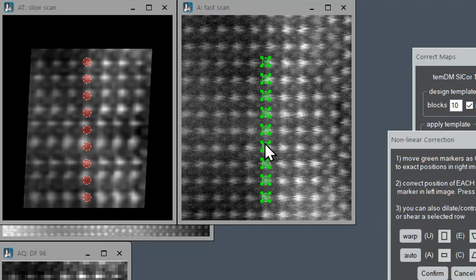Okay, I think we positioned that more or less correctly. And now let's look at the red markers. They are not at the right position. We have to position each marker at the right place. Maybe something like that. Like that. Like that. Well, it takes time, but the result will pay off.